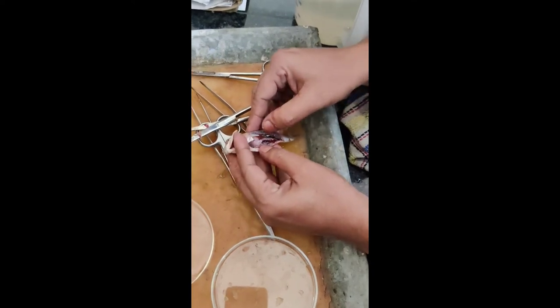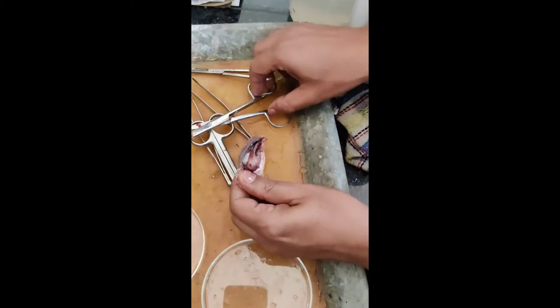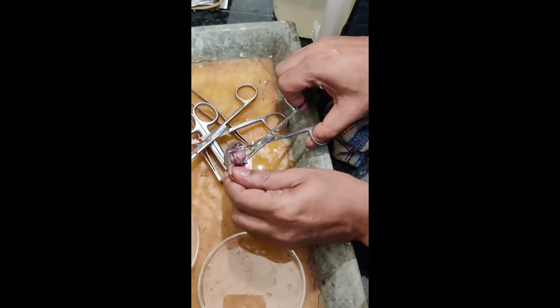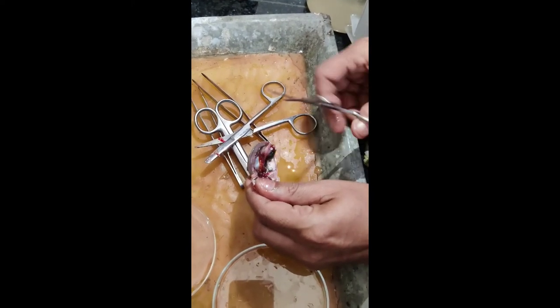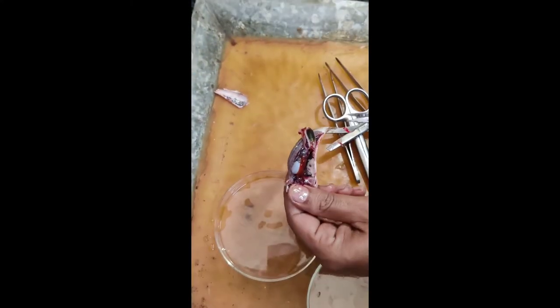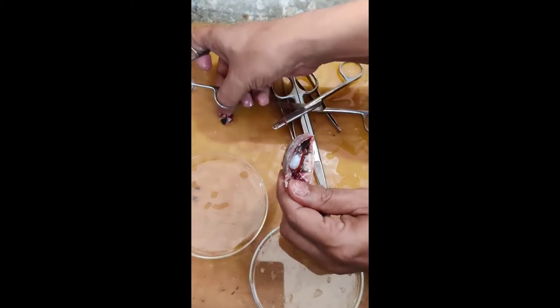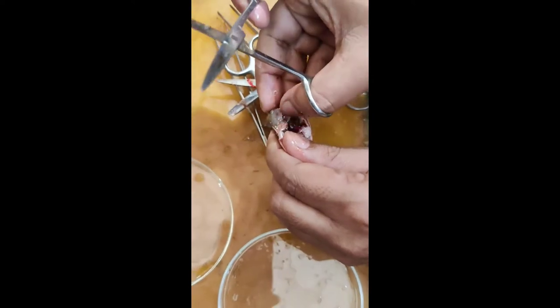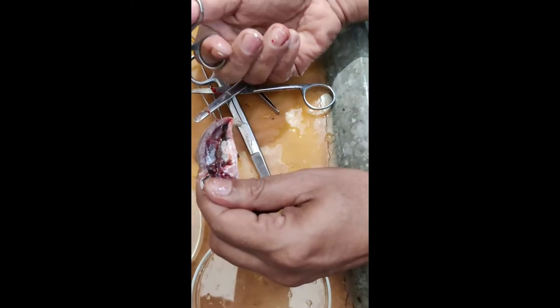I'll do another piece. This is the intestine — I'm not so much efficient in identifying the organs. In the upper heel, this is blood. And this one is the swim bladder. This one is the liver, associated here, and this is the intestine — that long one.